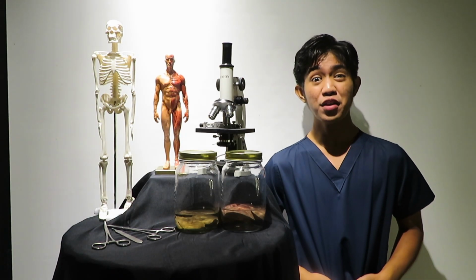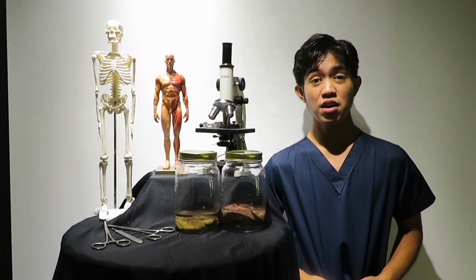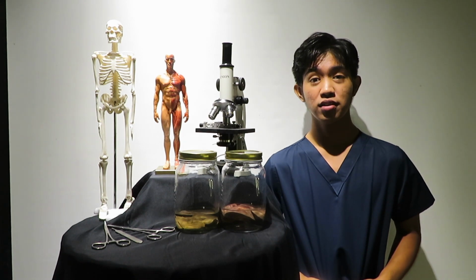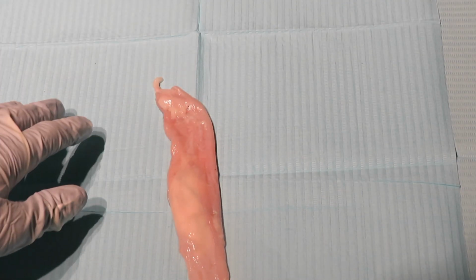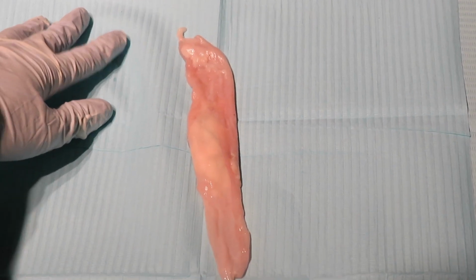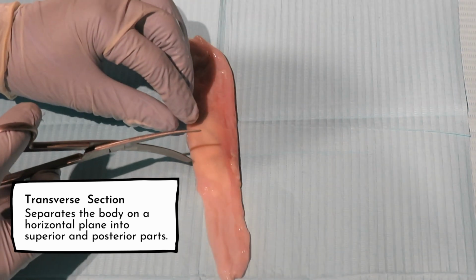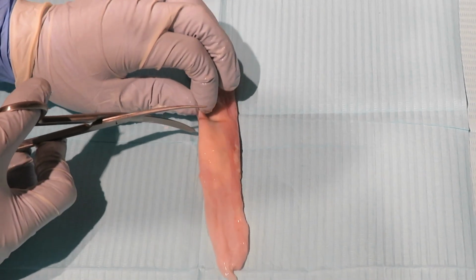So what if there might be a rupture of an abscess from the intestine of the pig that caused an infection in the whole body? Let's find out. I remember that if there's any case like this, my attending advised me to cut along the transverse plane of the ascending colon to see the cross-section of the intestine.